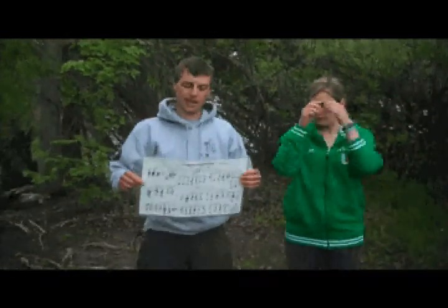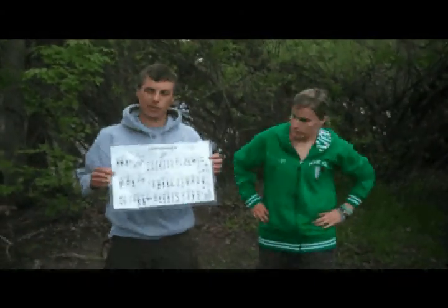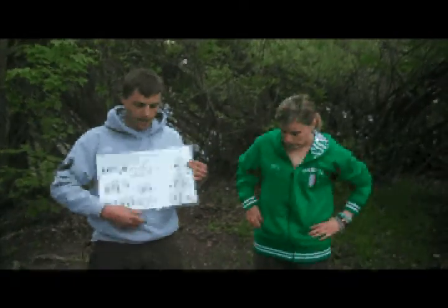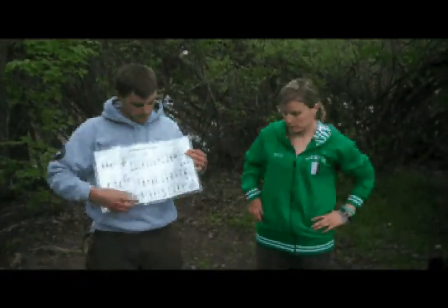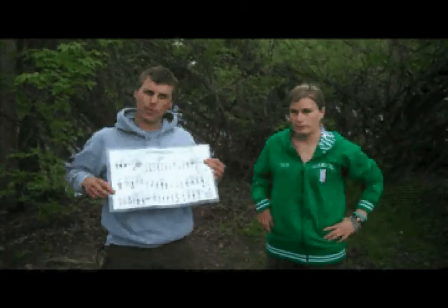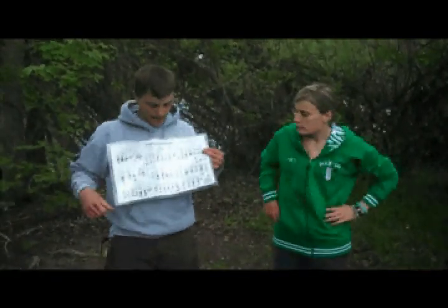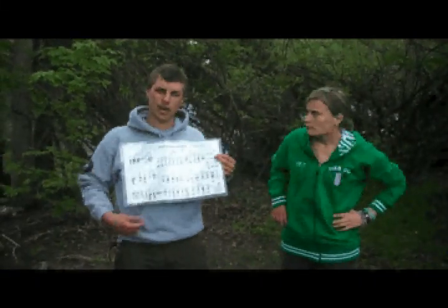So inside your kit there's a dichotomous key that will help you identify the different macroinvertebrates that will start to release off of the rocks and swim around the water column, or will still be holding onto the rocks, so you need to find them and pull them off. These drawings are not to scale, but if you're able to follow the questions and work your way down, it should give you a pretty good sense of what they're like. And there'll be some key determinants at the end that will allow you to tell one from another.